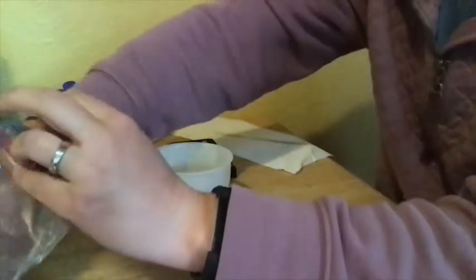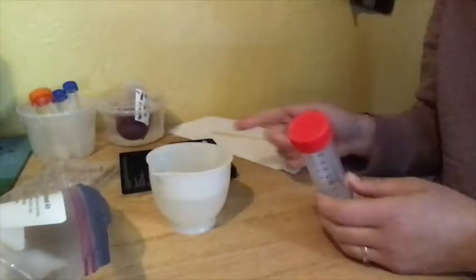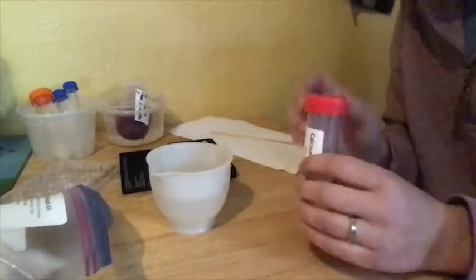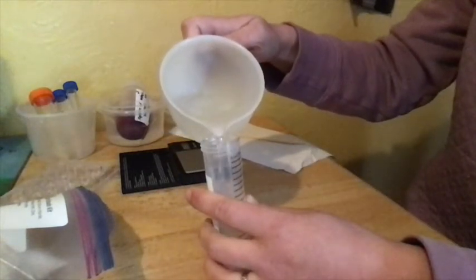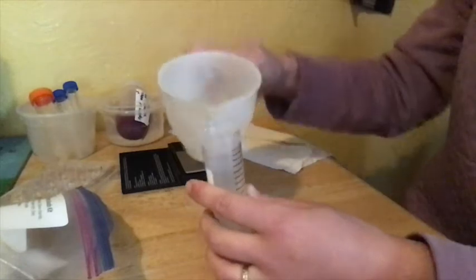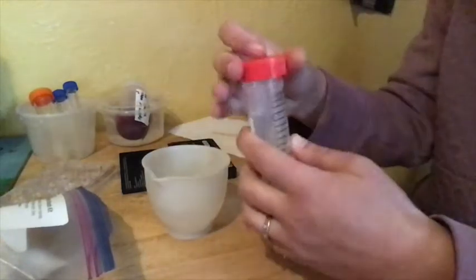You're going to make your calcium chloride tube, which is conveniently pre-weighed for you. We didn't want to get any cross-contamination of the weight out there. So, you're going to just use some tap water, fill this up to the 40 milliliter line, and mix and make sure this completely dissolves.